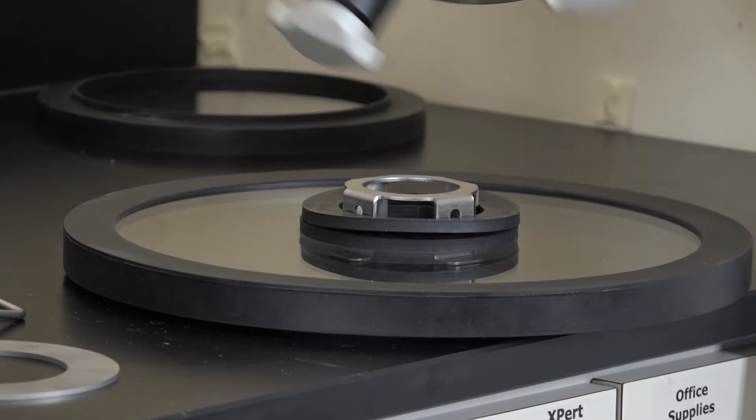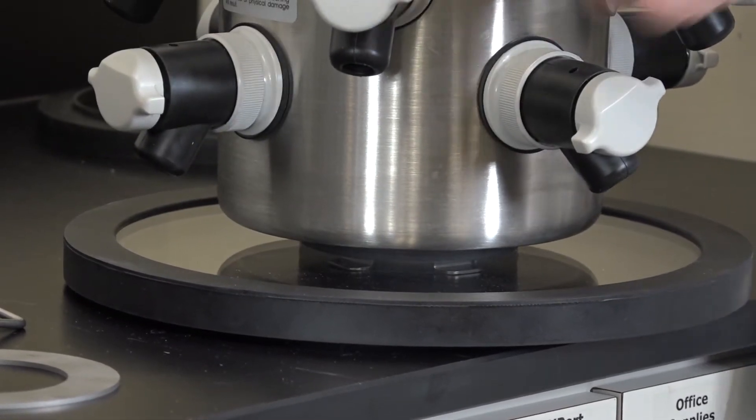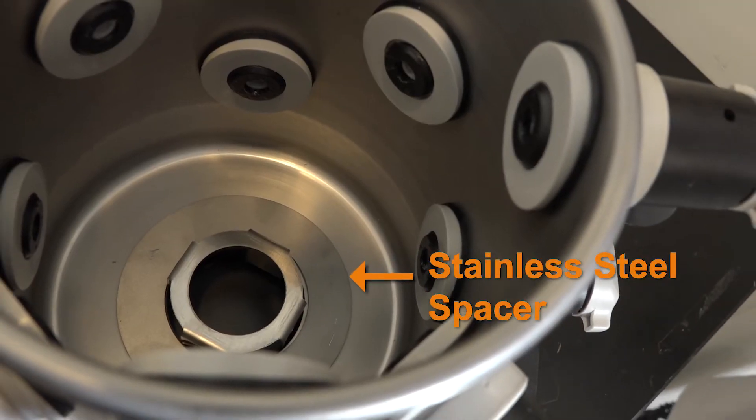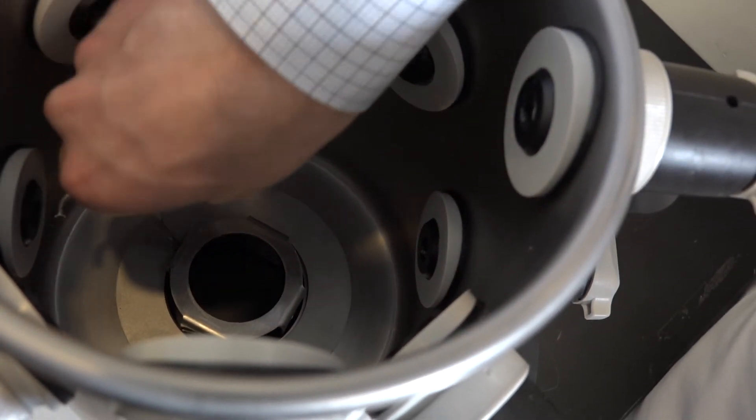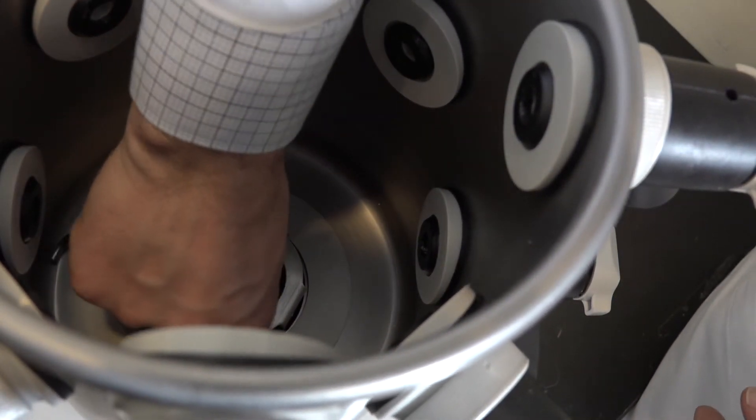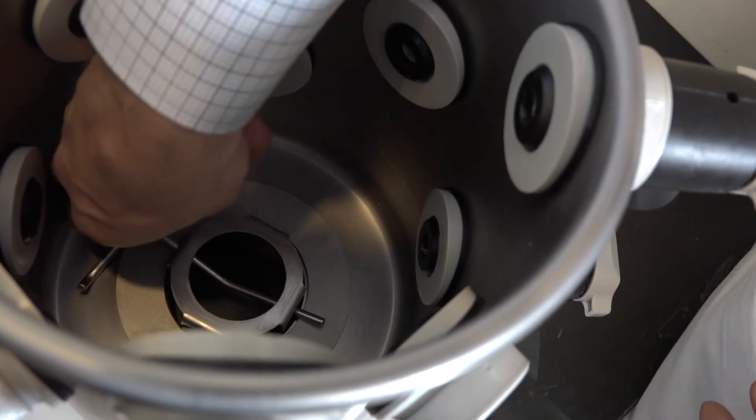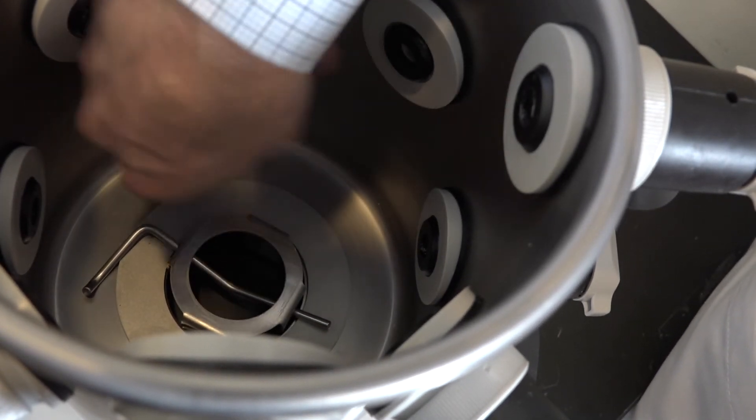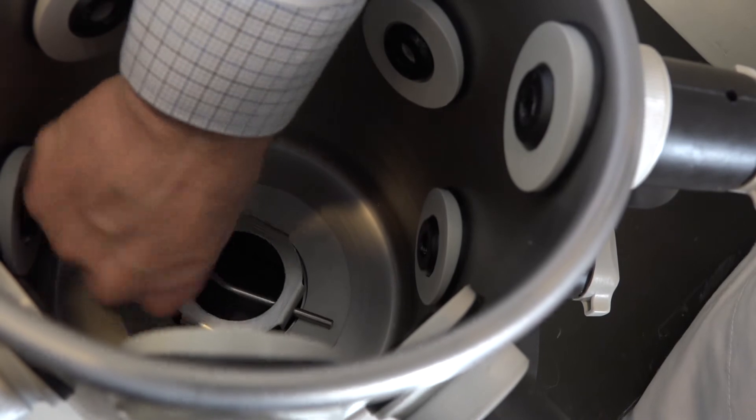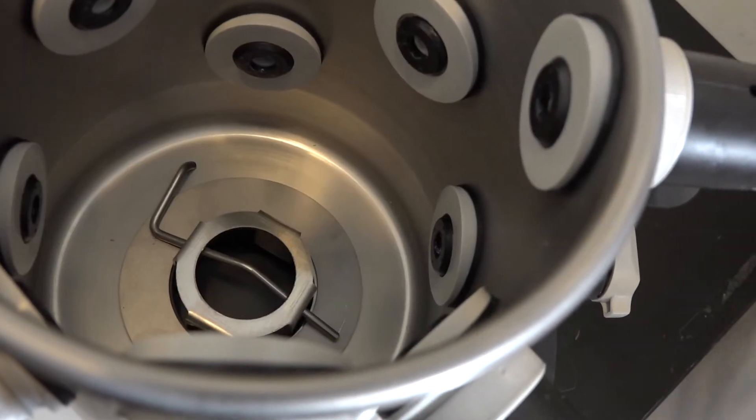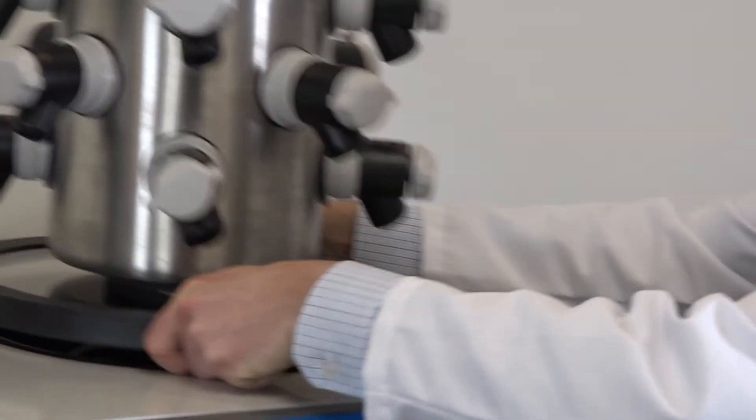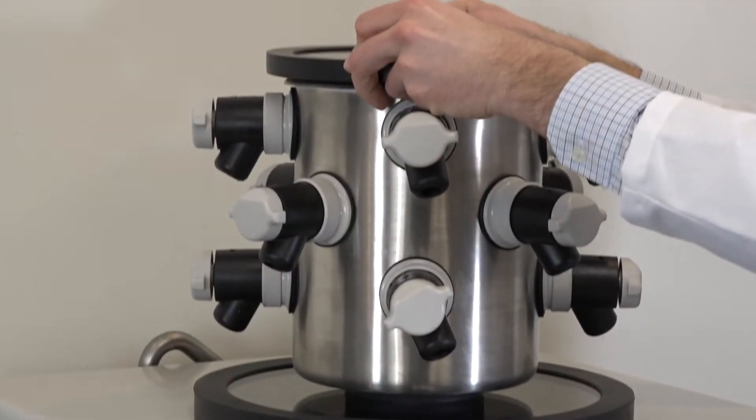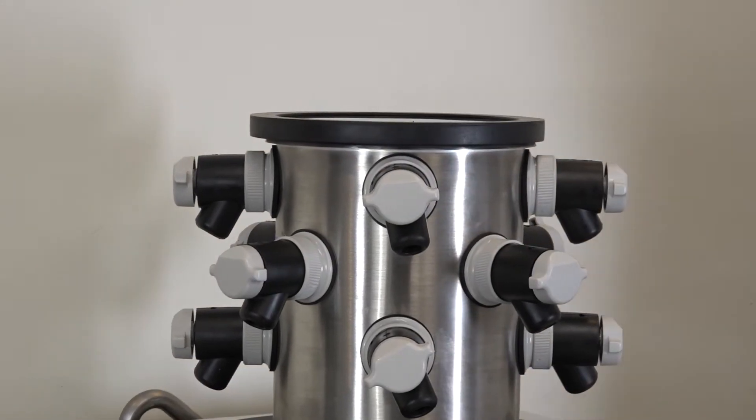Center the drying chamber over the gasket. Place the stainless steel spacer on the collar. Insert the latching pin into the collar. Push the pin through the collar until the bend of the latching pin is in the middle of the hole. Don't push the pin in all the way. Turn the pin so the assembly is latched. Place the entire lid over the collector. Installation of your drying chamber is now complete.